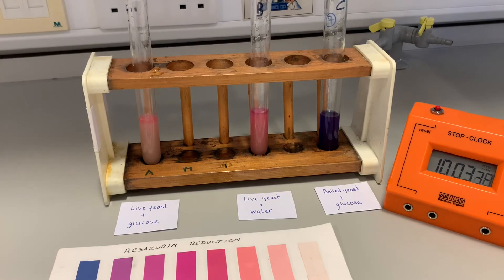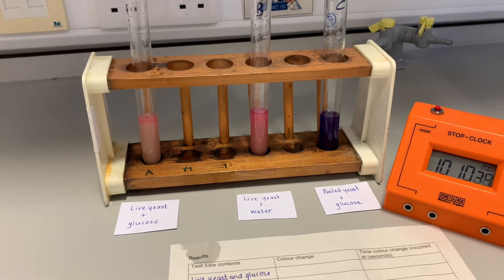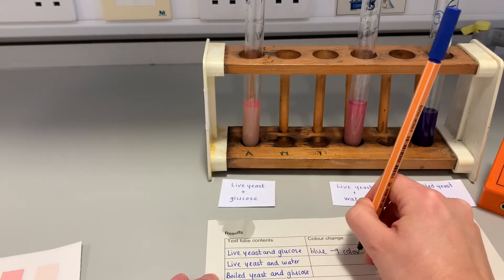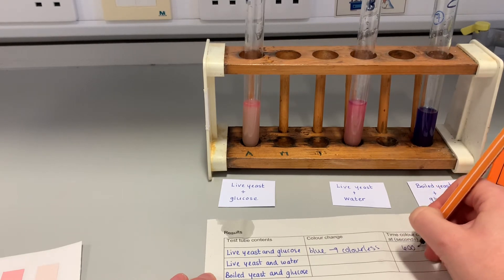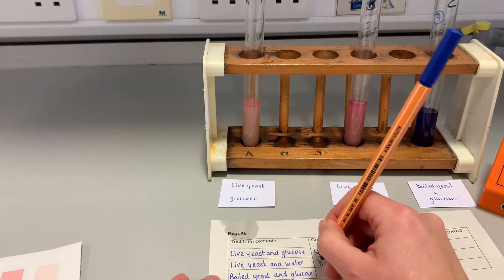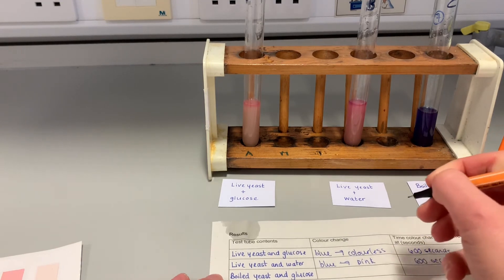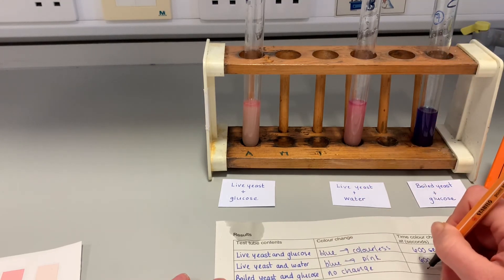Looking at the results at 10 minutes: our live yeast and glucose has had a significant color change — it's gone from blue to colorless by around 10 minutes, which is about 600 seconds. Our middle tube, live yeast and water, has gone from blue to pink over the same time frame. The boiled yeast and glucose tube has had no change within that same 600-second period.